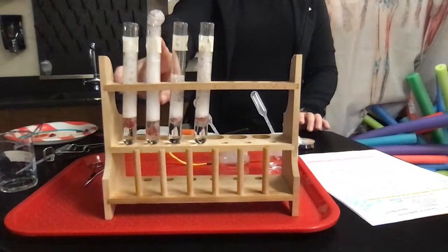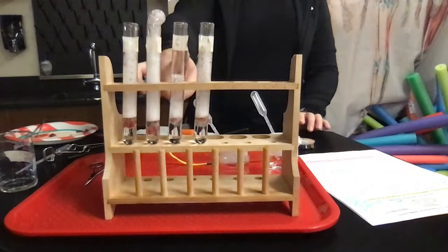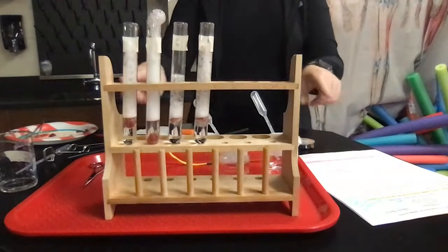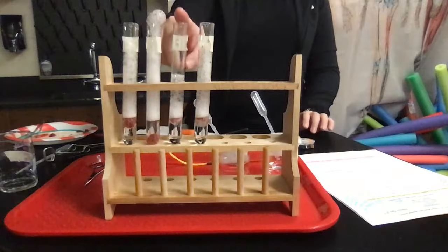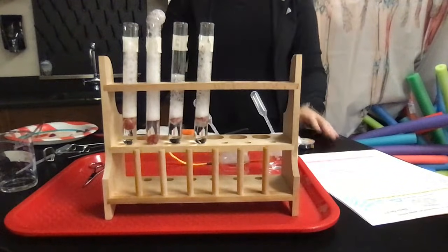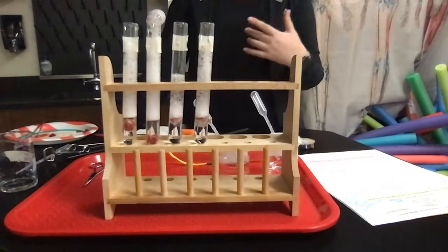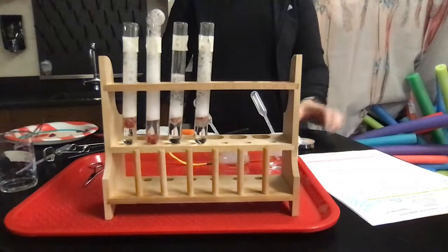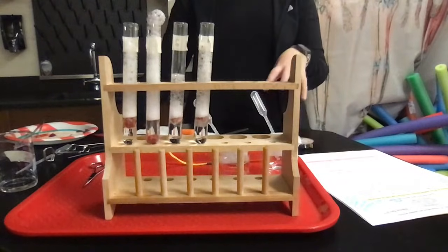And then 2 would be towards the tail ends of the bell curve for our enzyme activity. So 2 is definitely the most acidic environment, which is not the optimal environment for this enzyme, which makes sense because you don't have a whole lot of acid in your body where you would find catalase, right? So this is how pH affects the activity of catalase.